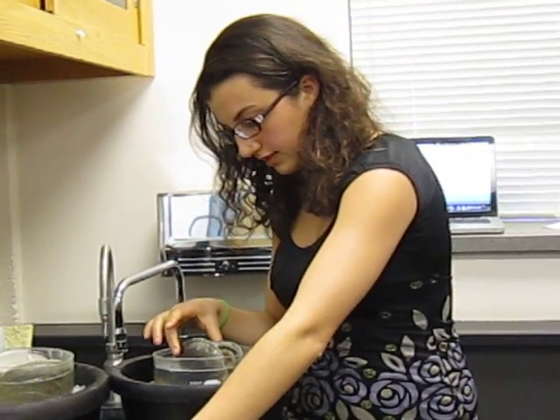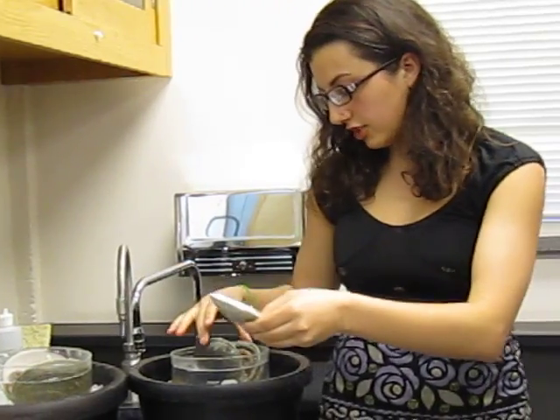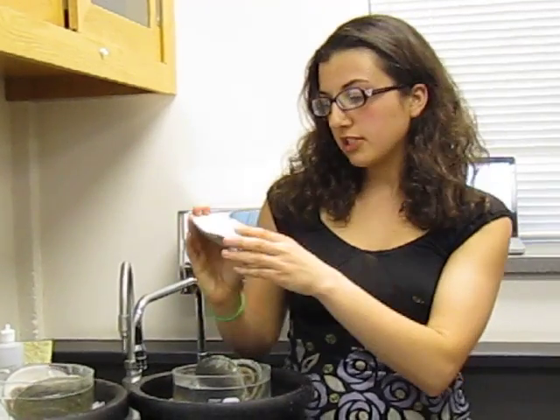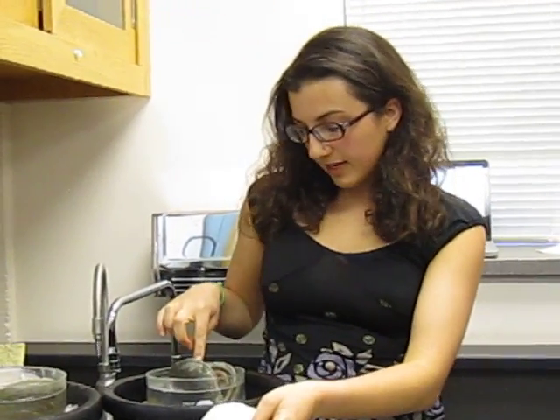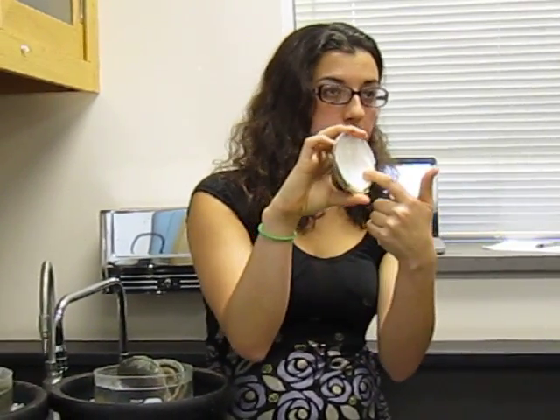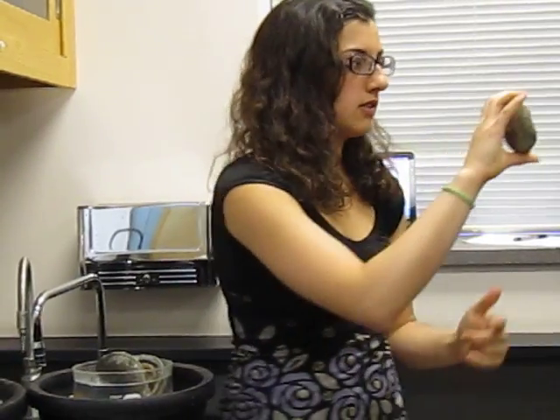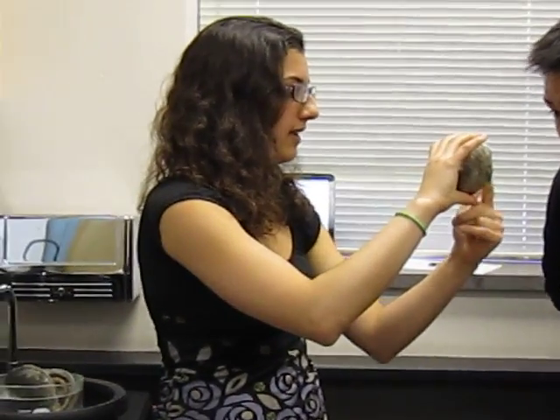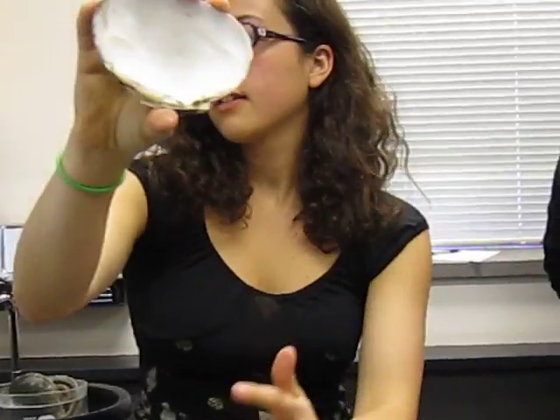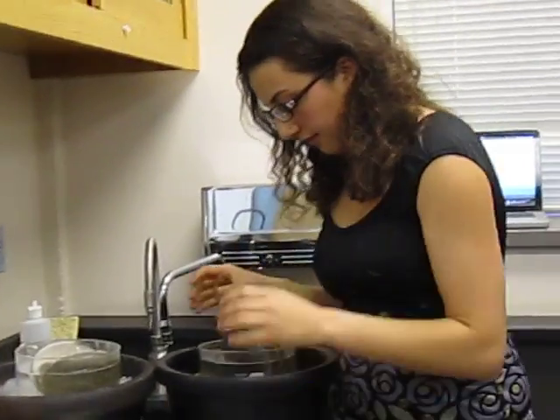So now let's start with, oh actually, first I want to mention the adductor muscles, which are used in closing the clamshell. You'll be able to see them in this live one, and you'll be able to see those scars of the adductor muscles. You should know what they look like. You should know which one is the anterior scar and the posterior scar. Can everyone see the little indentations right there? Yeah. And definitely look at all this stuff on your own. Okay. I think that's it for external.